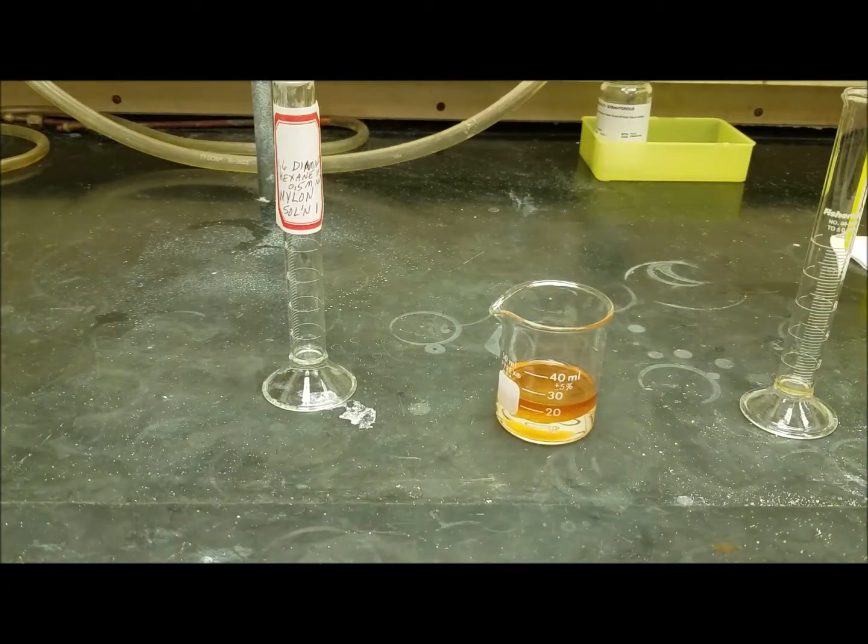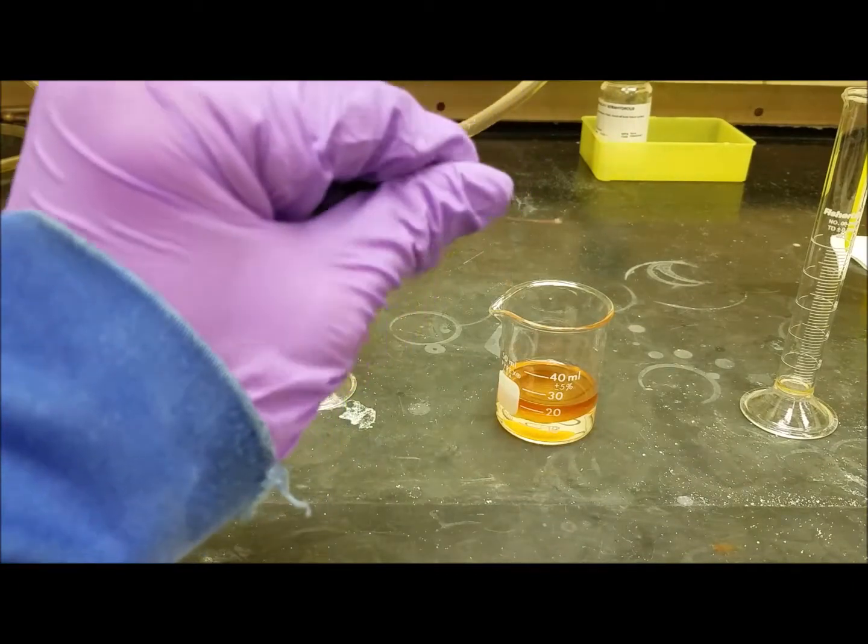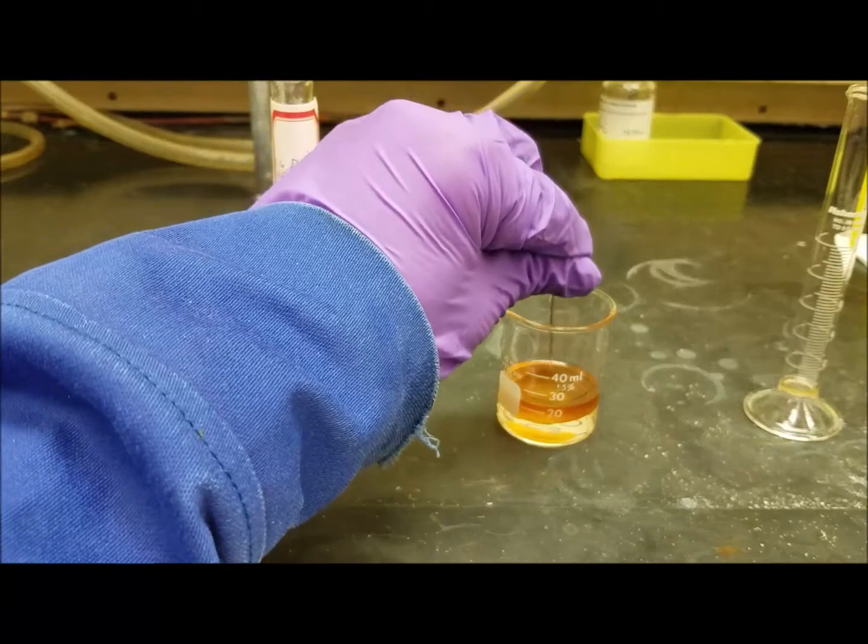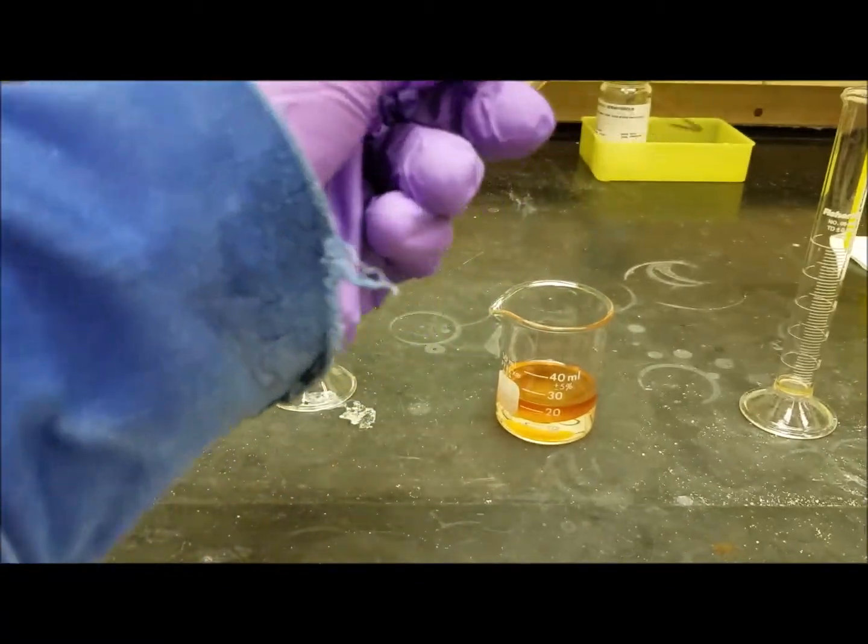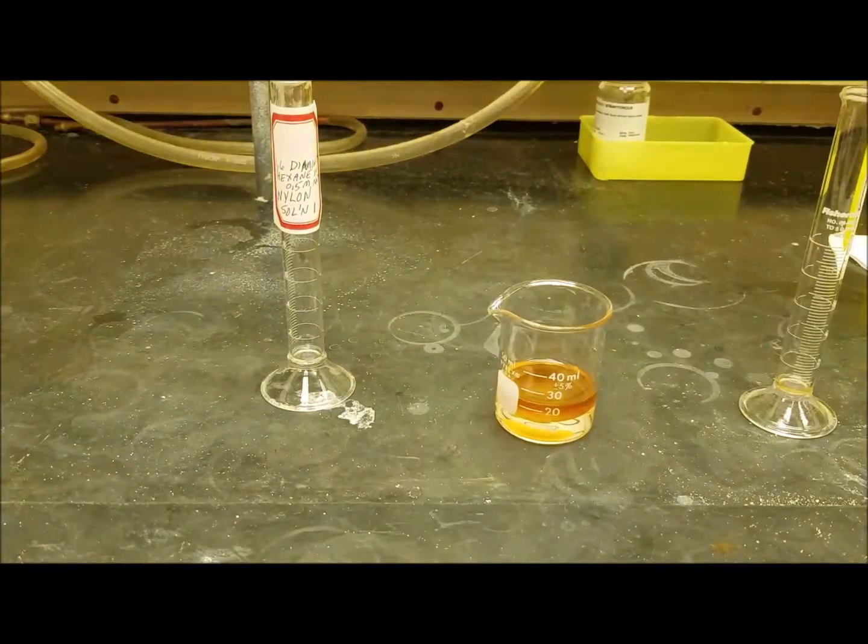So what we're going to do, and that's actually the nylon that's forming right there at the interface. It forms at the interface because that's the only place where the two compounds meet. So we've got a little, and we're going to hook the, let's see if I can get a better view of this.